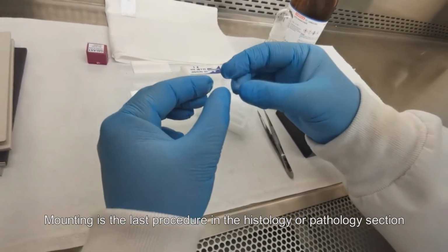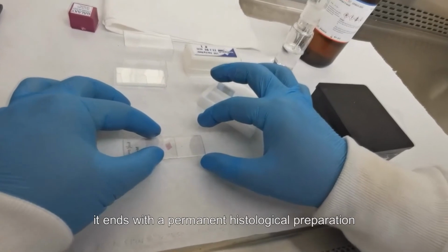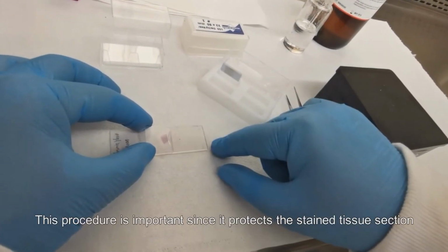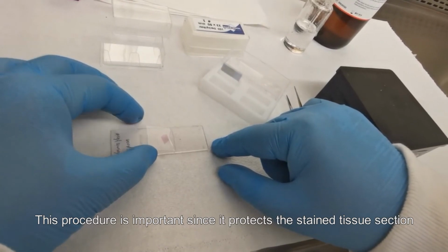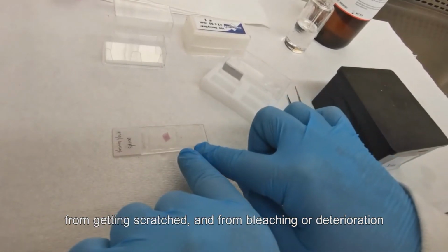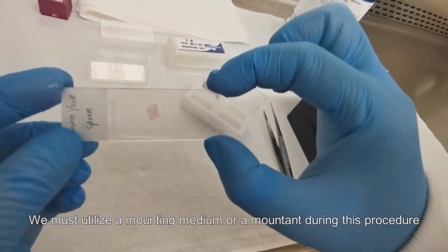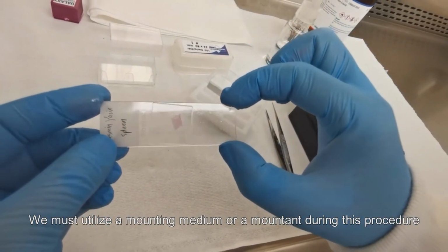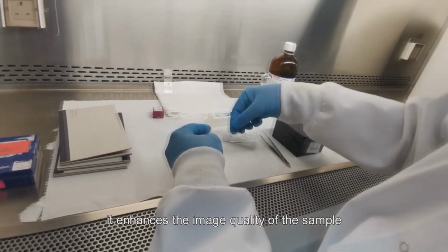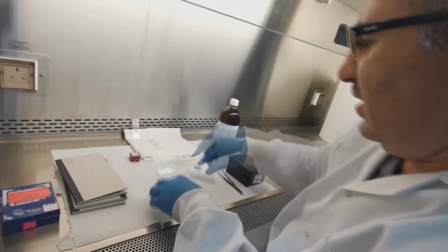Mounting. Mounting is the last procedure in the histology or pathology section. It ends with a permanent histological preparation. This procedure is important since it protects the stained tissue section from getting scratched and from bleaching or deterioration. We must utilize a mounting medium or a mountant during this procedure. It enhances the image quality of the sample, thus we can appreciate the microscopic details of the tissue.